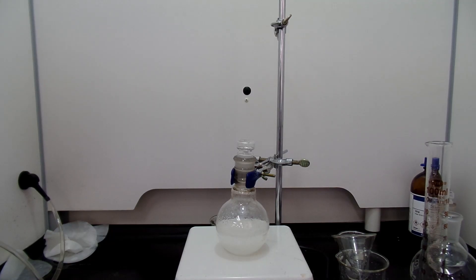So this video is about failure. I used both DCM extraction and direct fractional distillation method and failed. If you are interested in the complete guide of this reaction, this is not the video that you are finding.